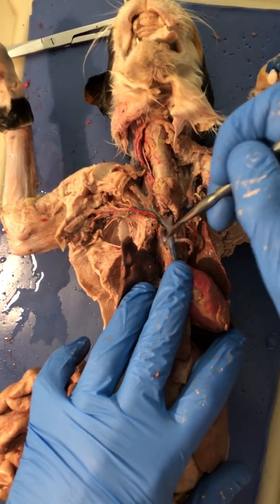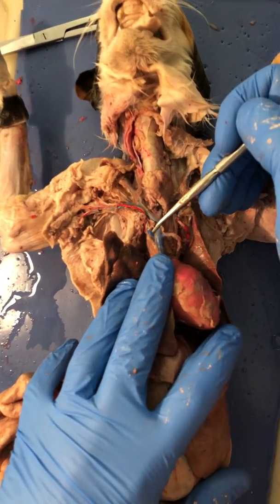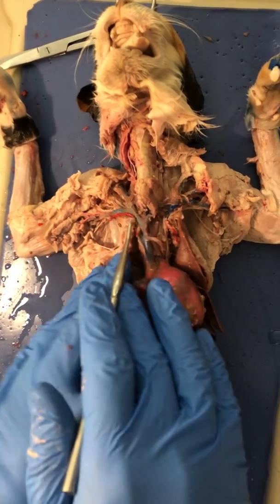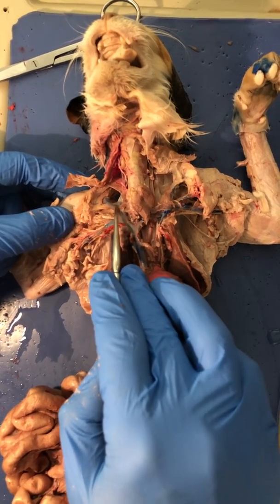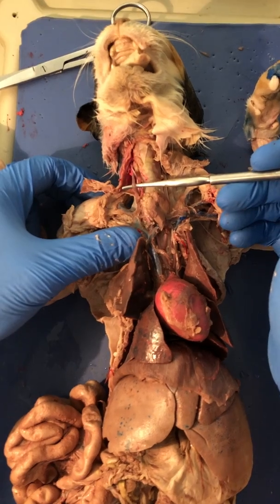I'm gonna roll over to the back side here because we have a vein that goes to the back, and this is called the vertebral vein. We'll just follow up one side here. On this particular side, again, the brachiocephalic, it's going to branch again where it comes up. We have the external jugular, and you can see it a little bit right here, the internal jugular.